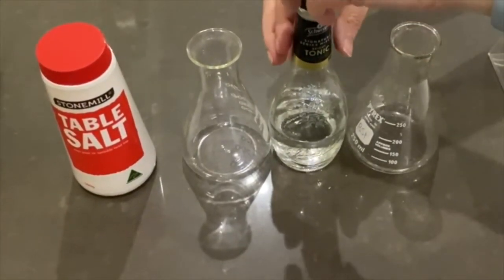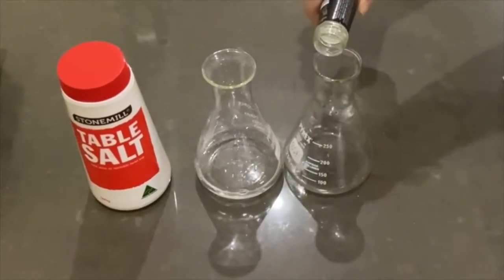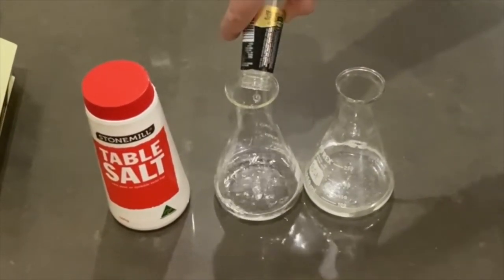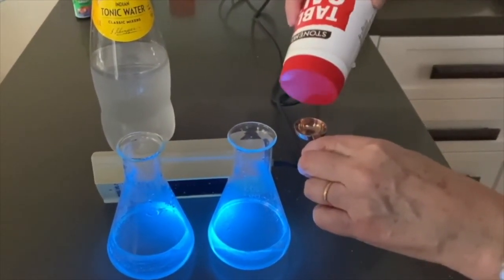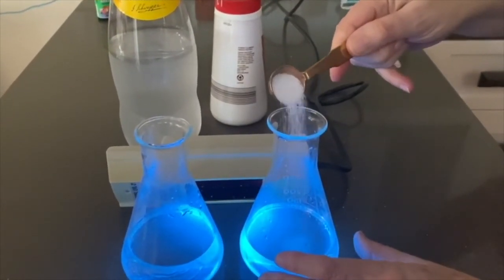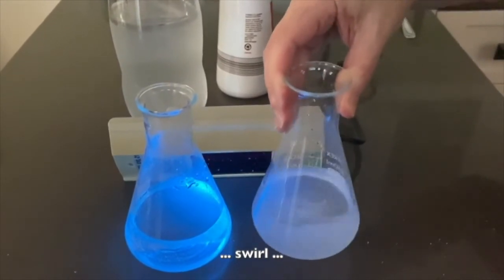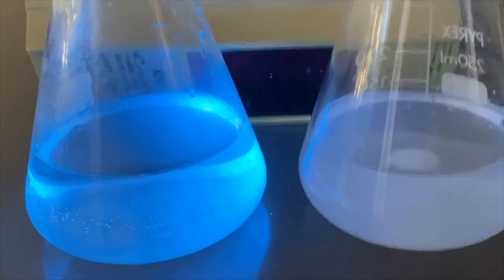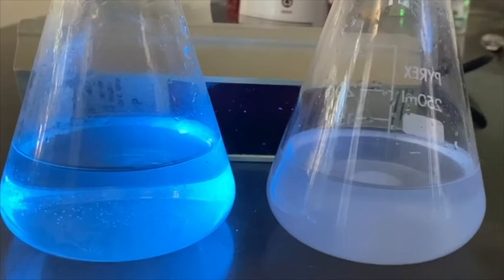I'd now like to show you a demonstration. I'm going to take the tonic water we had previously and separate it into two flasks, then excite both solutions with 366nm light as before. I will then add about two grams of salt to one of the flasks, mix it through by swirling and agitating, and observe what happens. You will now see there seems to be no fluorescence in the solution that had the table salt added. Can you postulate what is happening here — what is the reaction and what is fluorescing? We will discuss this in our question and answer session.